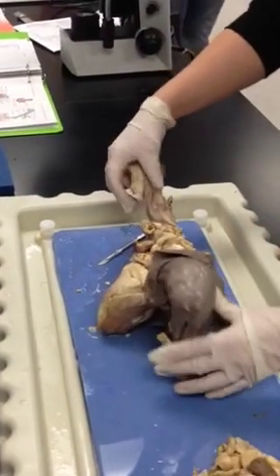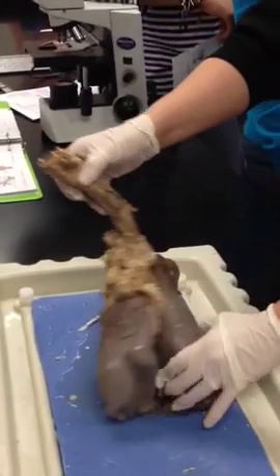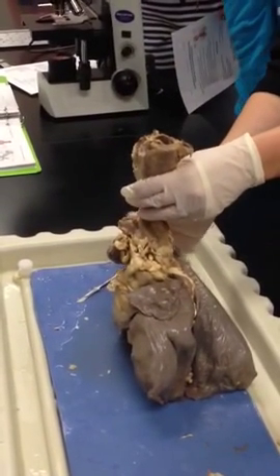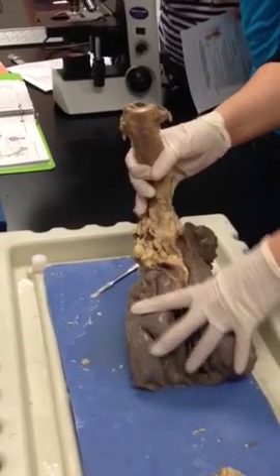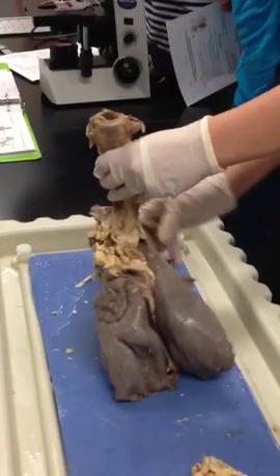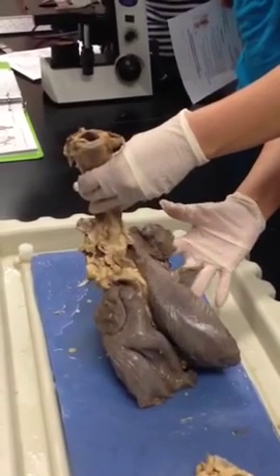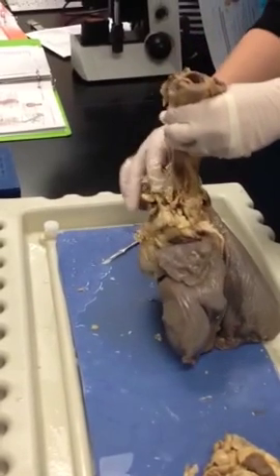I know. Alright, so when you're looking at it, it's just like this, alright? In a sheep, the heart is anterior, right? The lungs are posterior. So this would be the posterior side of the lungs. This would be the anterior side, okay? Just so you understand. You feel like, all right, well, if this is anterior, then the right lung should be on the right, right? And here's your 3 lobes. So that's how you know it's the right lung, and this is the left one. Okay, does that make sense?